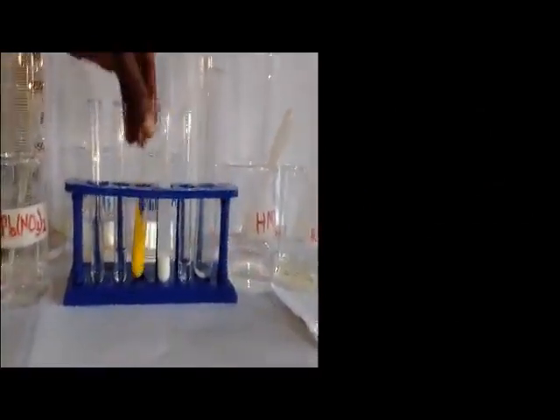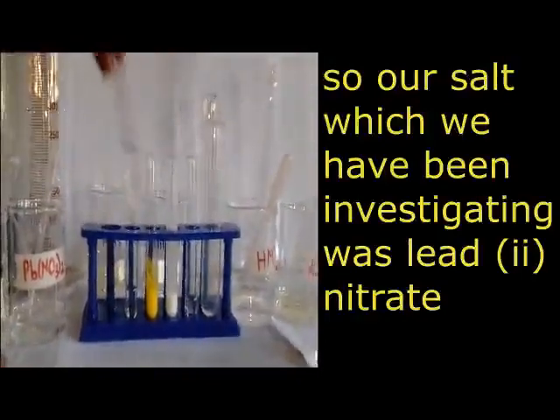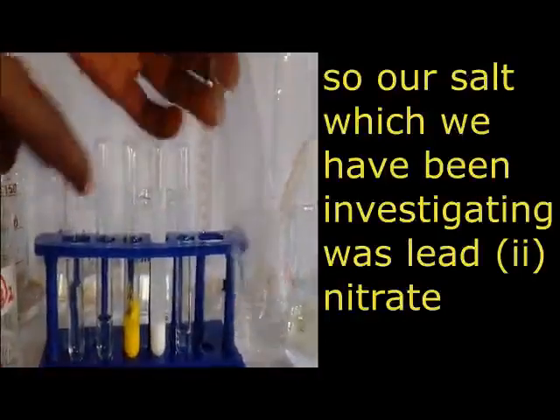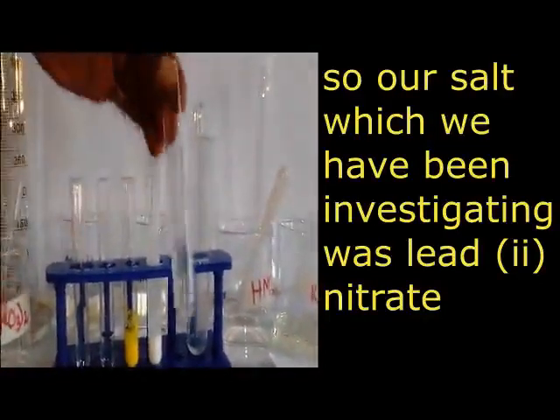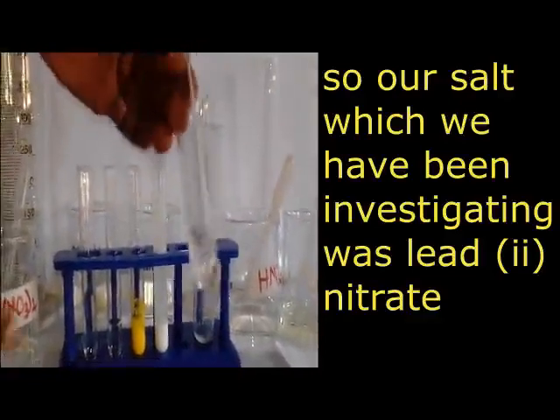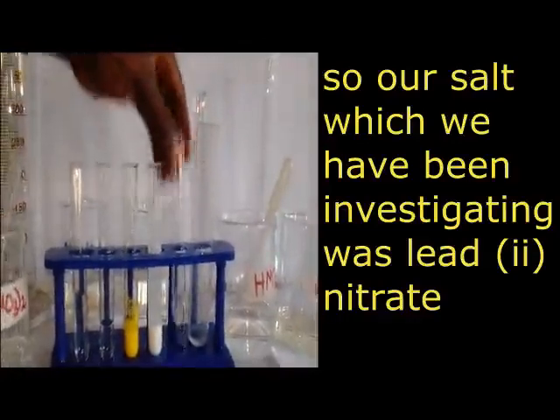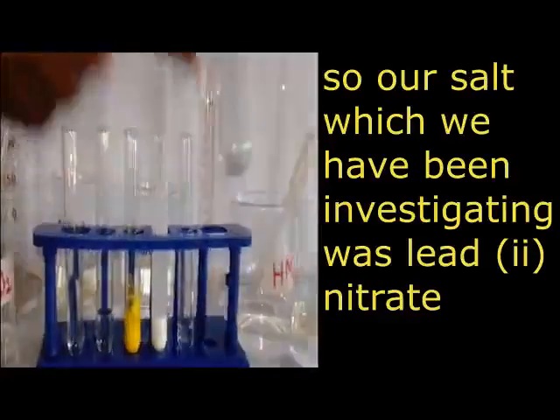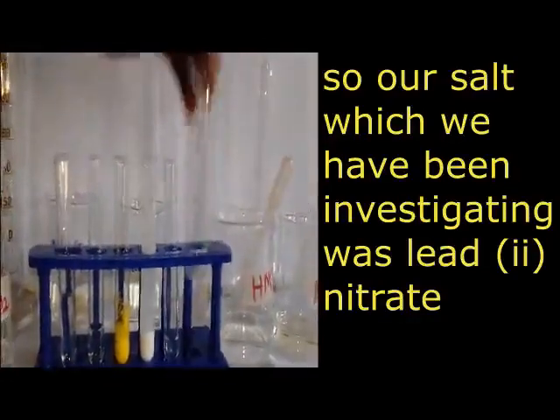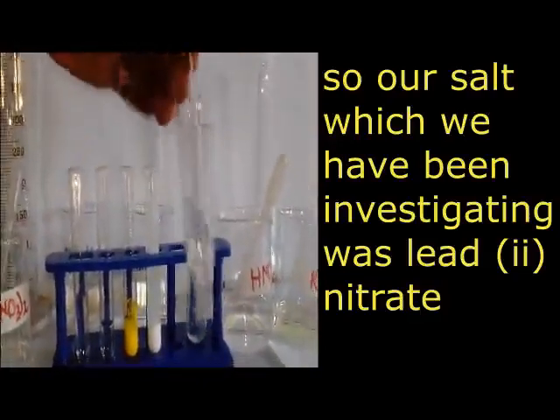Where they are putting, we are going to start the ending of the question paper. We are putting there the cation present and the anion present. Then our salt now, we can say that our salt was lead nitrate. Now, to wrap up all the tests we have done: first, we dissolved our salt in water, giving a colorless liquid. Then the second one, we added sodium hydroxide, where we formed a white precipitate soluble in excess, giving a colorless solution.